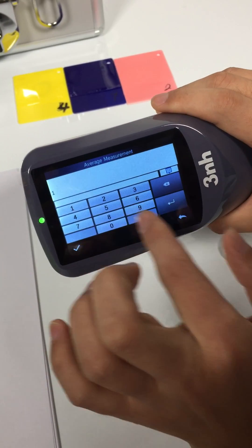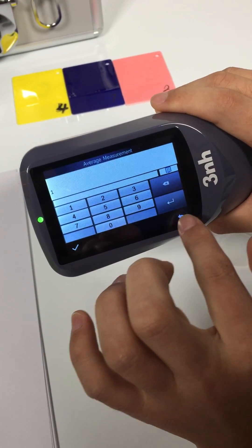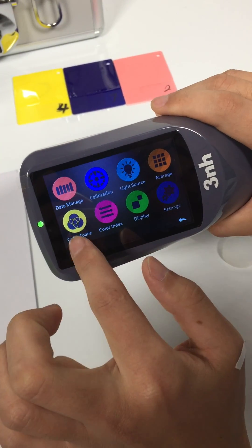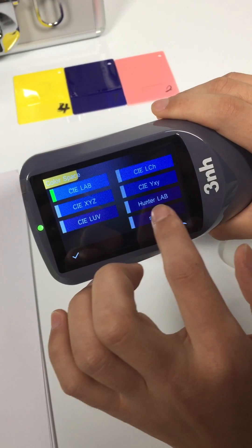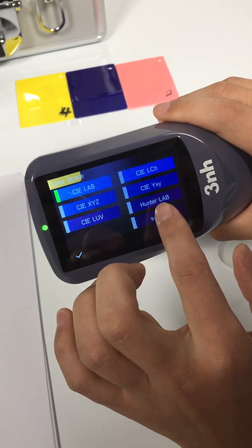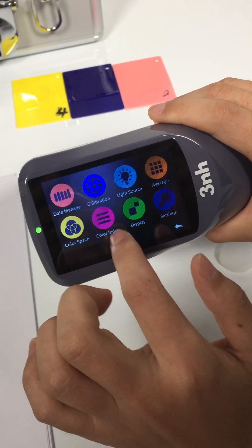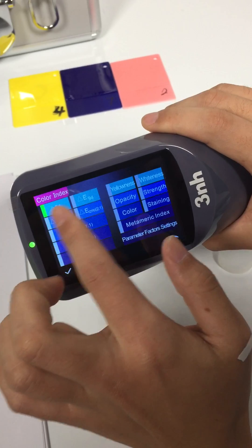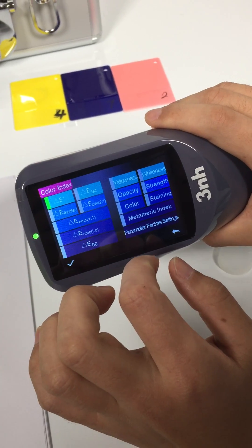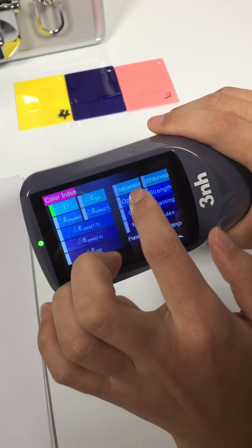Average measurement settings. Color space — choose different kinds of color space here. Color index — choose different kinds of color index here.